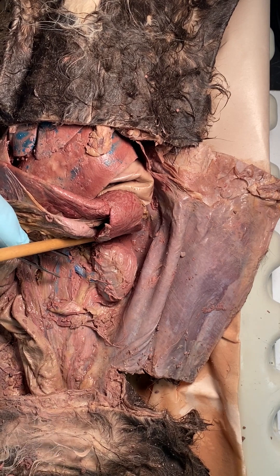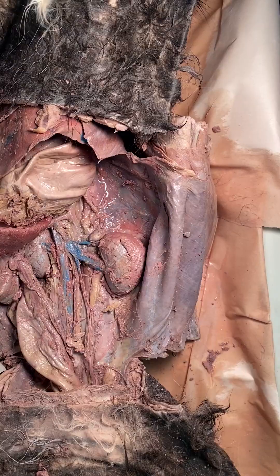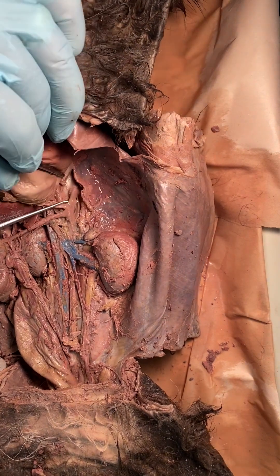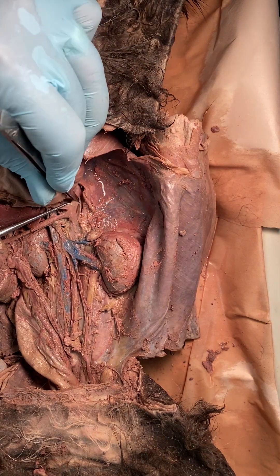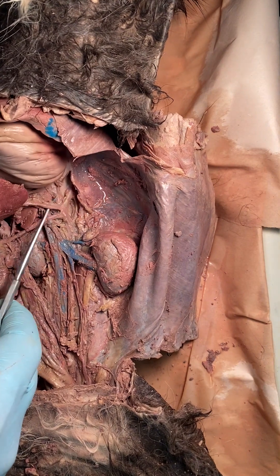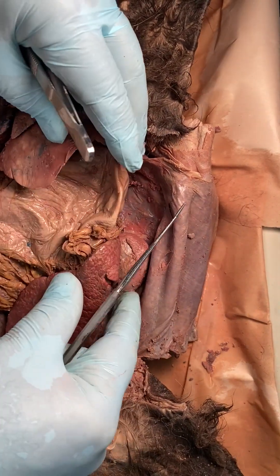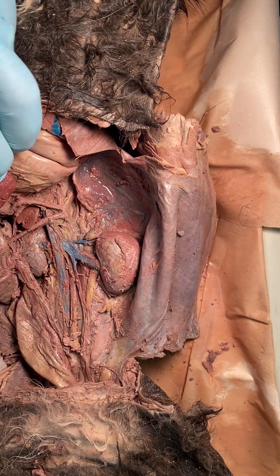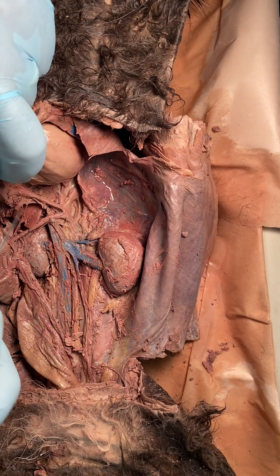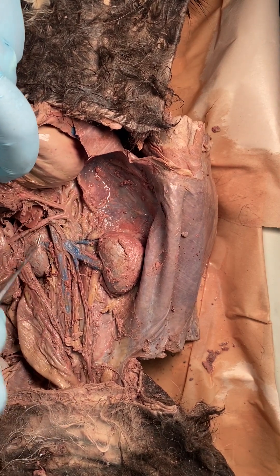Now that you've found the renal artery and vein, follow them back. The renal vein goes into the inferior vena cava, but we're doing arteries — the renal artery goes into the abdominal aorta. The probe is underneath the abdominal aorta right now. The first branch we need to verify is the celiac trunk — it's going toward the spleen, stomach, liver, and pancreas, located most superiorly.